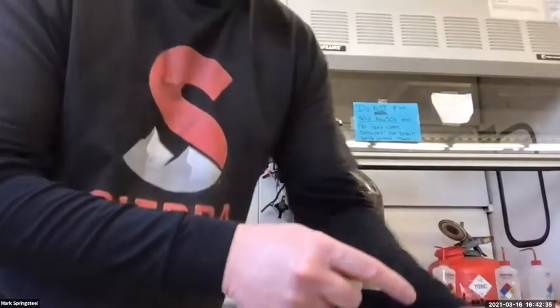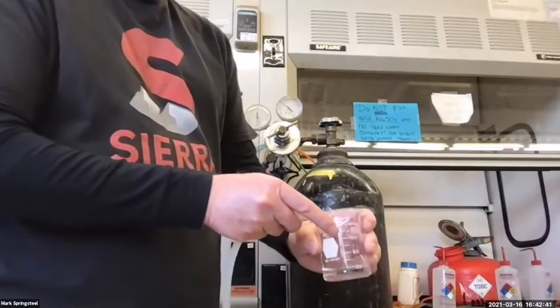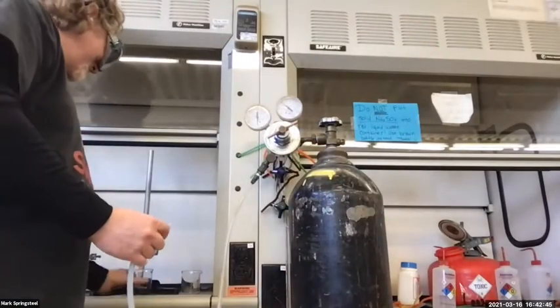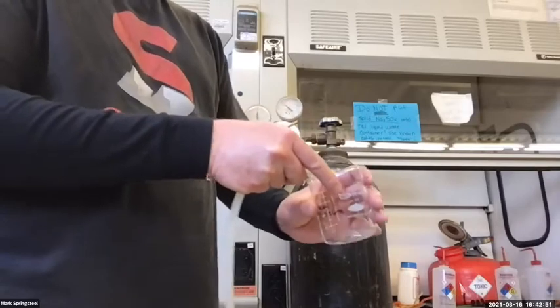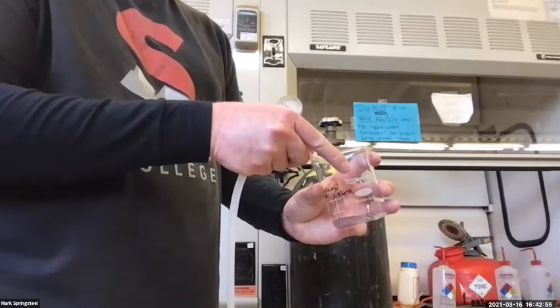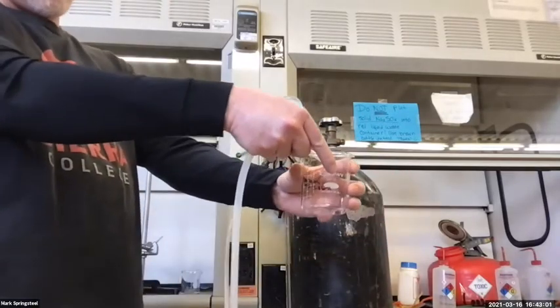So I'm going to pause on that one. That one's looking pretty good. And then I'm going to see if this might be... This one's good. Oh, that's the water. Here's the water, would take forever. This is the benzocaine. And as I'm doing this, it's getting cold. Let's see. It's getting very cold. My pinky feels like I'm touching an ice cube almost because of all the evaporative cooling.